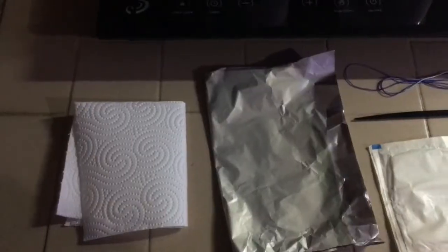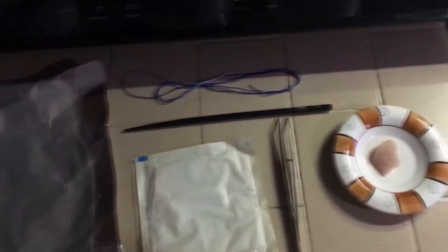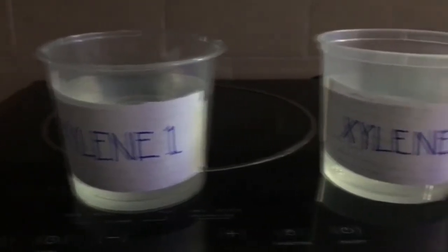Hi, I'm Hannah Eng Fo, and I'll be performing the clearing technique. Before anything else, we have to make sure we are wearing our complete PPE. Let's go! So these are the materials that I will be using, and these are the reagents.